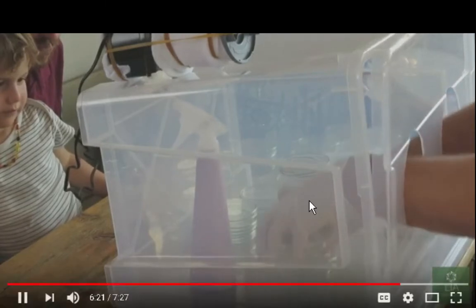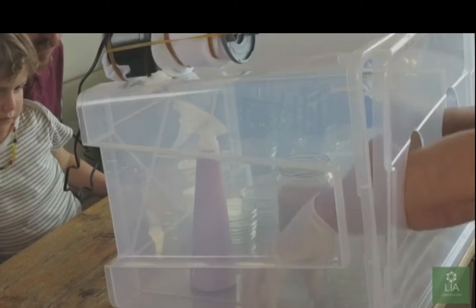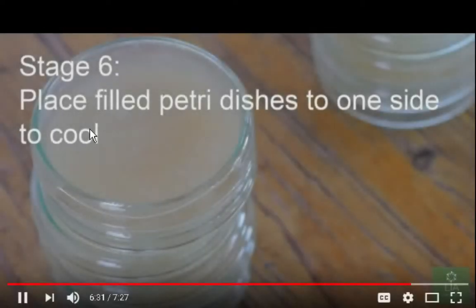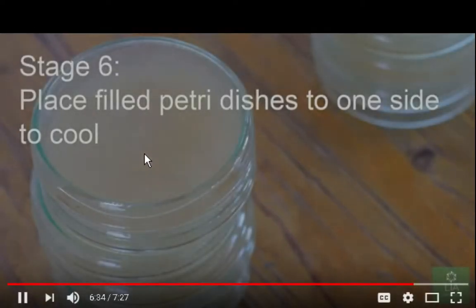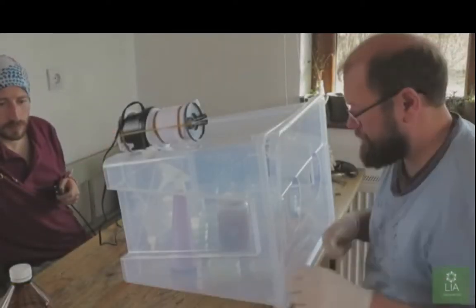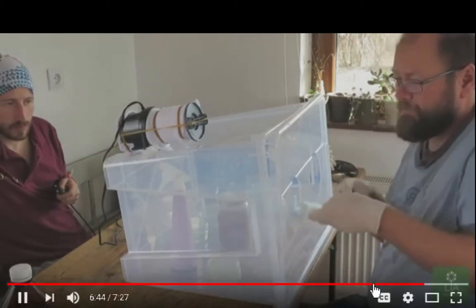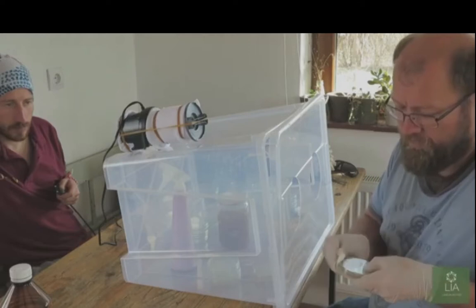And the way he's doing that, they could also end up getting bubbles in Petri dishes. Well, let's see what's going on. Place them to one side to cool. Once we've got those Petri dishes, we can leave them on the side now just to cool down. We don't want to open up the Petri dishes anymore. No. They need to be sealed until we're ready to inoculate them.